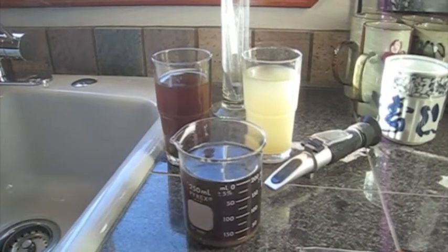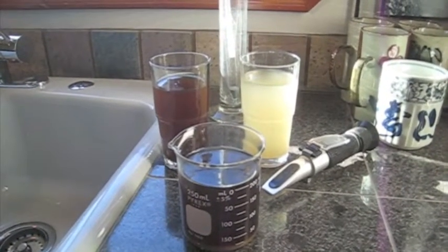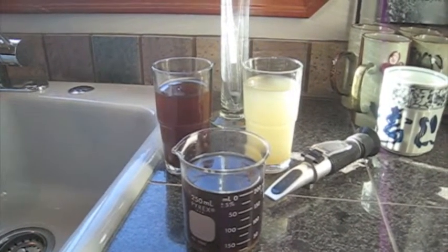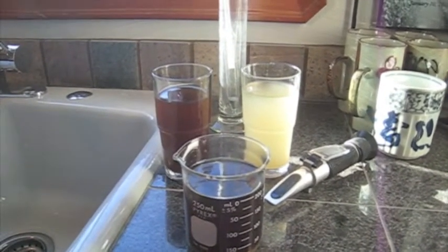Okay, we are all set with our three samples. I've recorded the various numbers using the refractometer. I have these three samples.